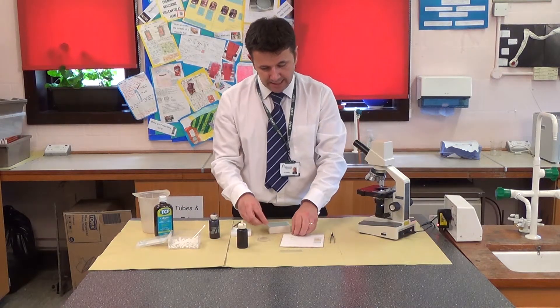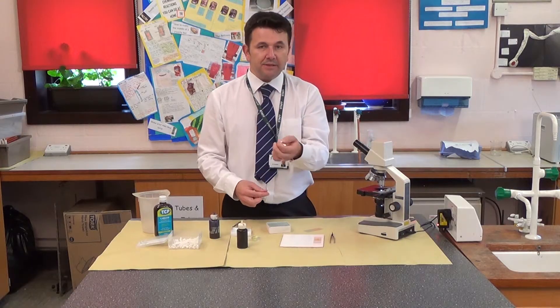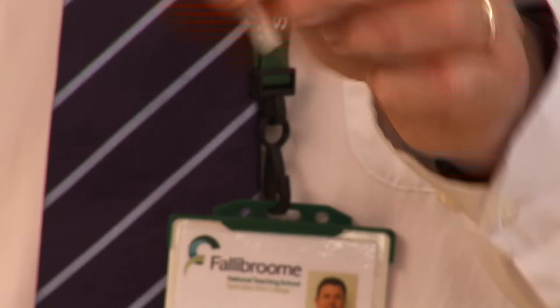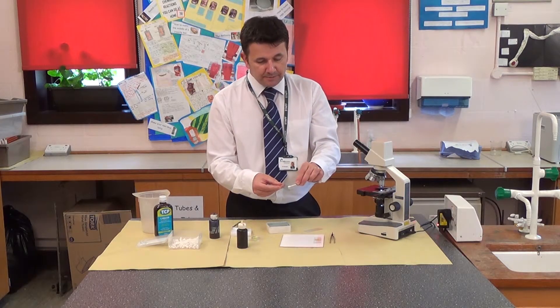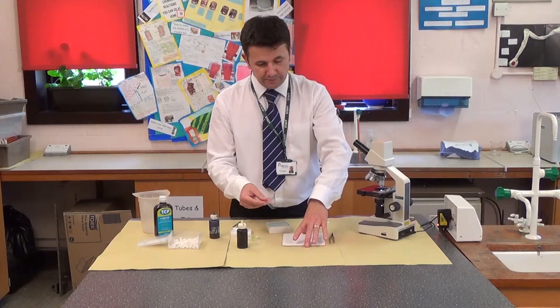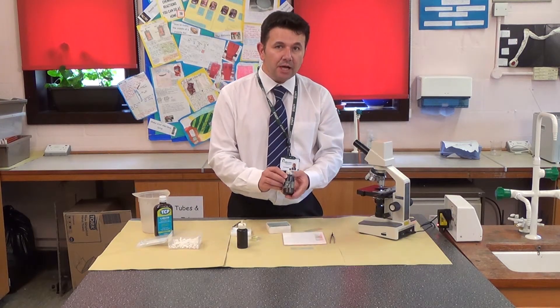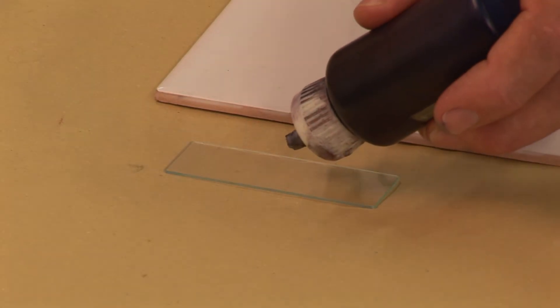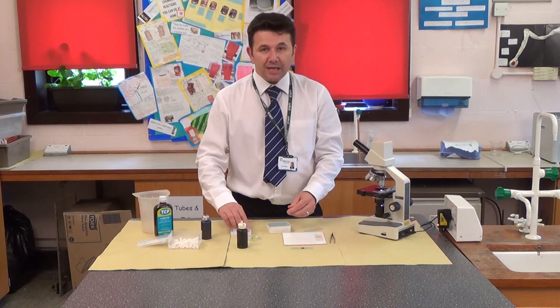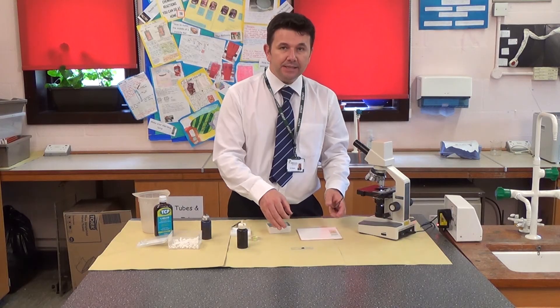Now there is another type of cell we can look at, which is an animal cell. We're going to use cheek cells. What I've done is gathered some cheek cells using a cotton bud — I've literally put it in my mouth and swabbed the inside of my mouth. I'm then going to use a slide and place the cells on there. Then I'm going to use a colour indicator called methylene blue — you only need one drop. You have to be careful with methylene blue because it stains, so make sure it doesn't get on your fingers, and if it does, wash it straight away.